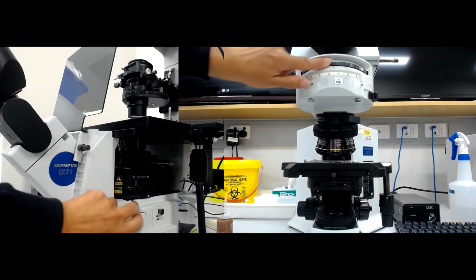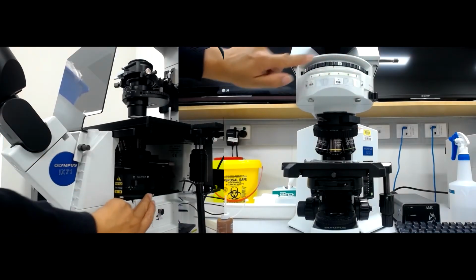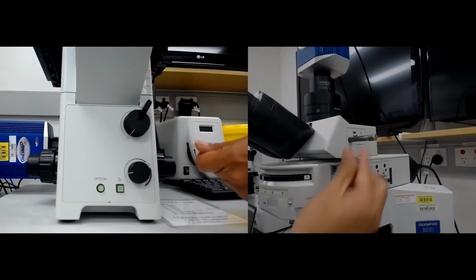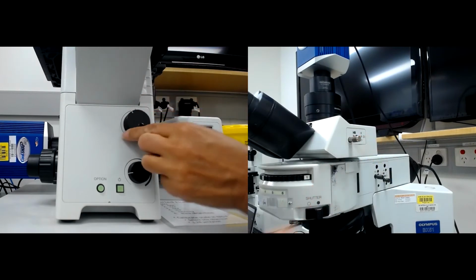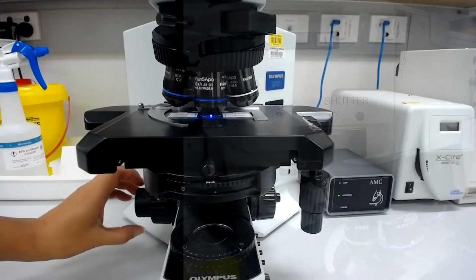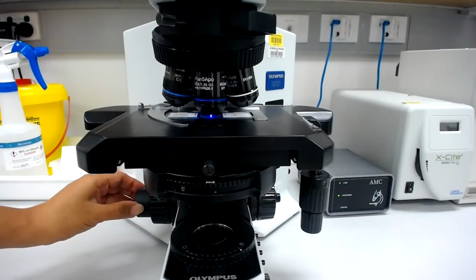Turn the emission turret so that the correct filter is in place for your fluorescent signal of interest. Make sure the light is directed to the eyepieces. Open the fluorescence shutter to illuminate your sample. Now focus on your sample again, and you may find the focus has shifted.